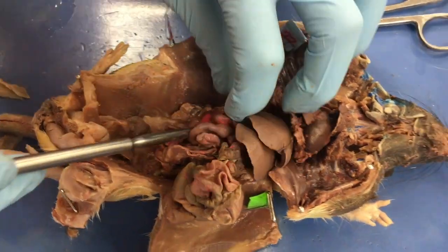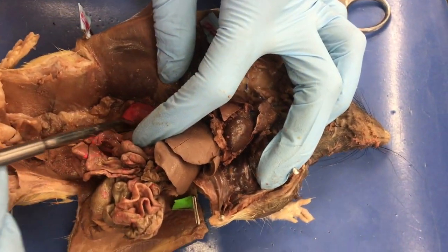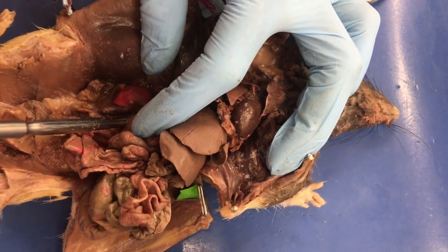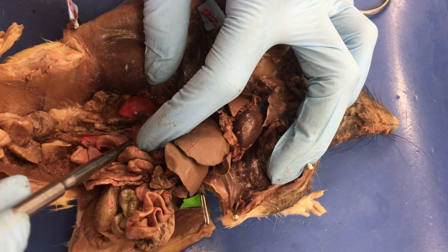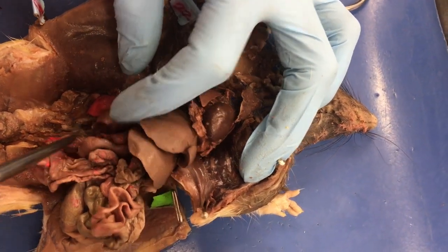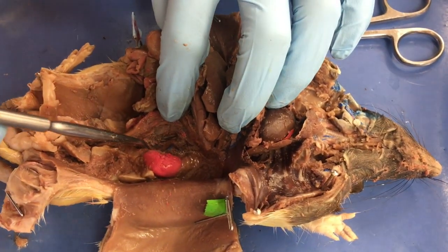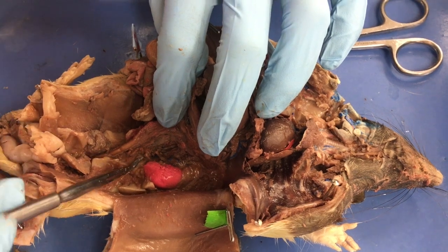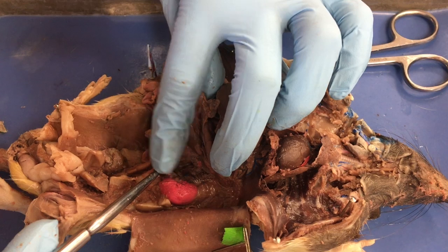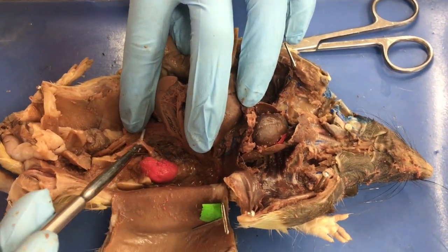All right, so the ureters, I'm going to have to move some of this stuff out of here. They're going to be coming from the kidneys, and they're really pretty thin too. Oops, just snapped him. Let's go this side then. And I'm sure you pointed out the spleen. So there's a ureter coming from the kidney.